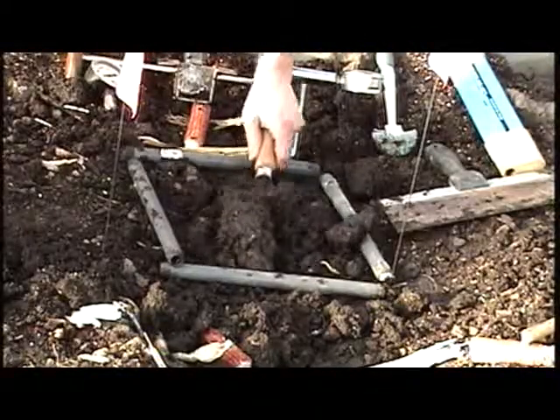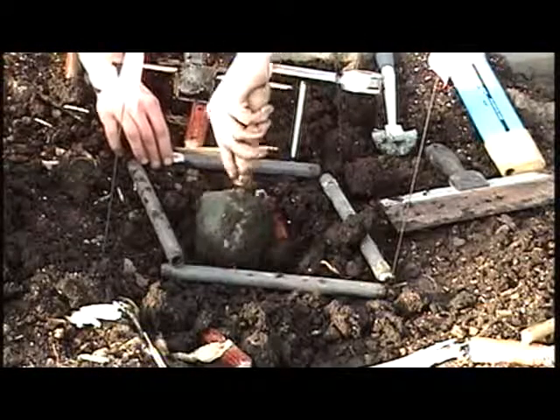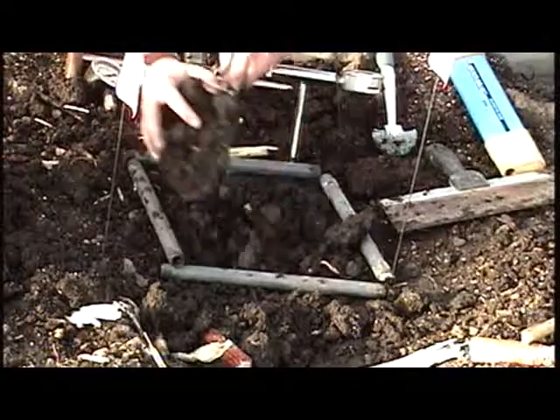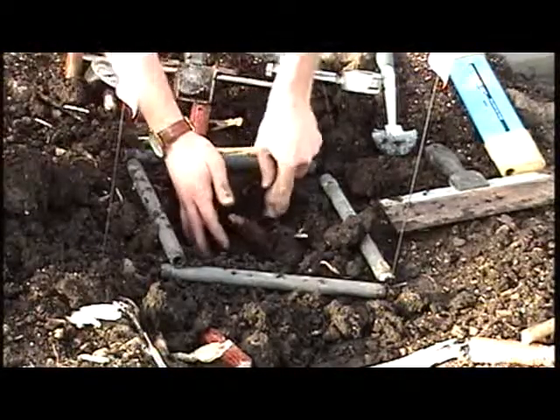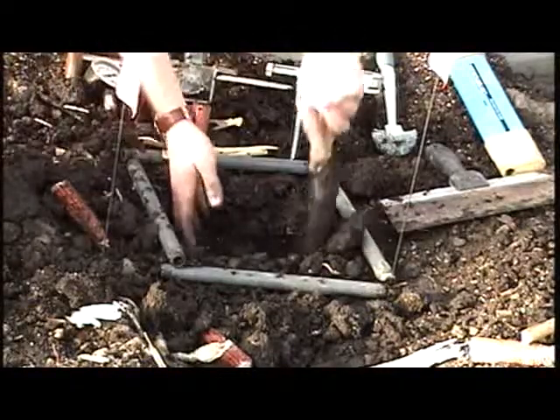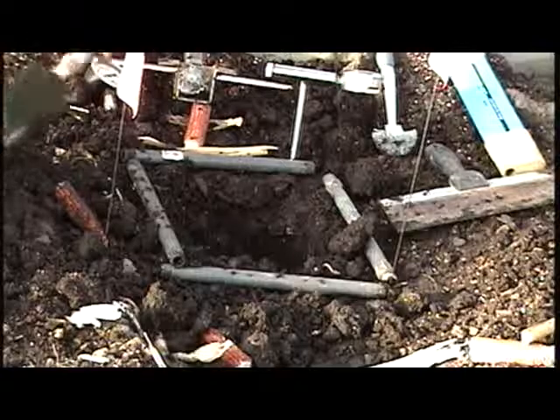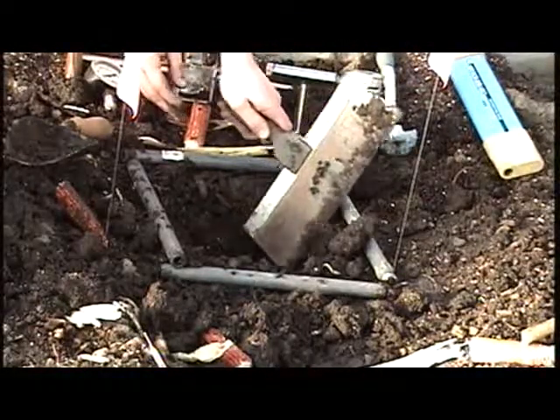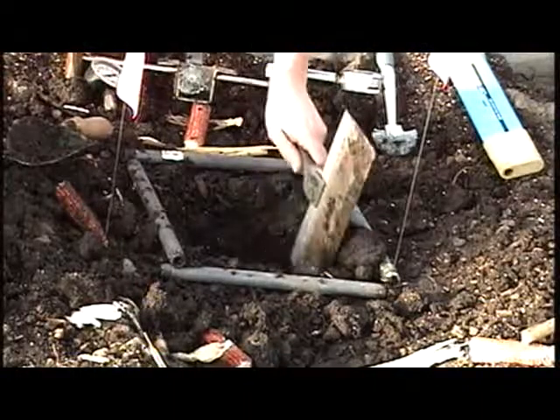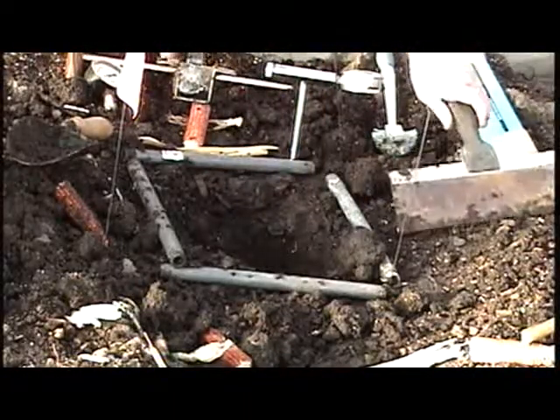After researcher 1 has removed the litter and taken initial measurements, researcher 2 will dig a hole approximately 1 foot wide by 1 foot deep. Researcher 2 will then expose a vertical soil surface using a spatula, disturbing the soil face of the pit as little as possible.